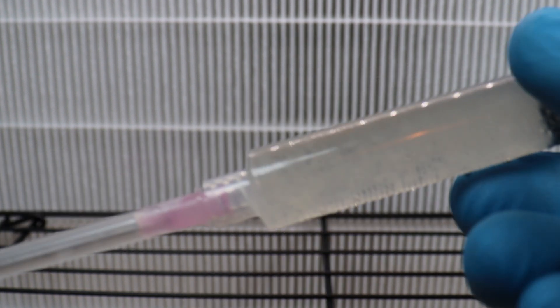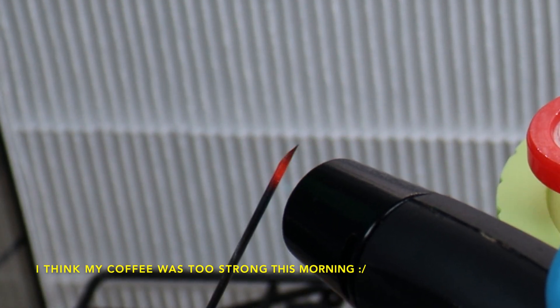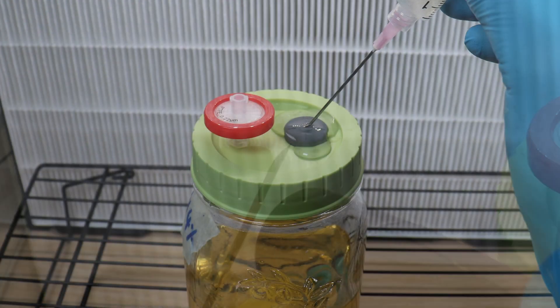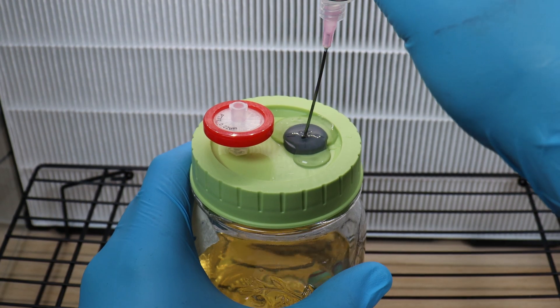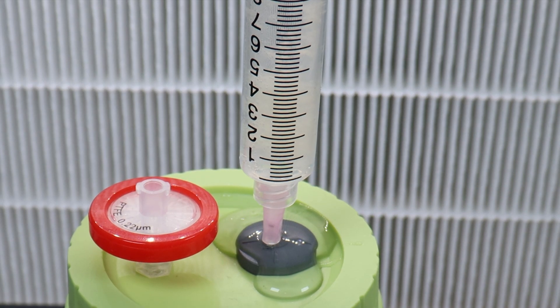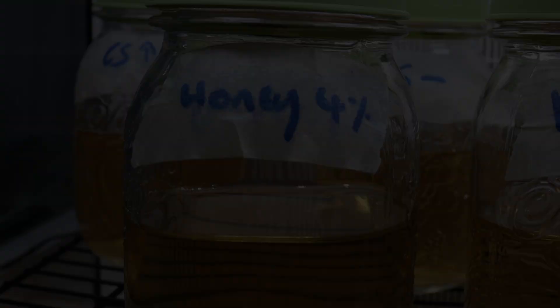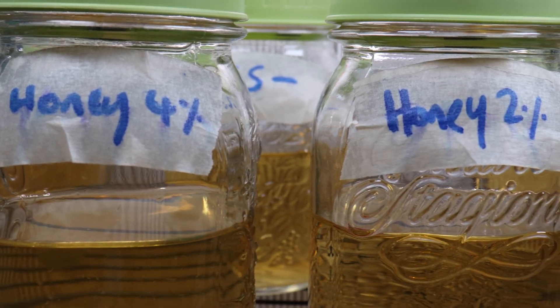It's time to inoculate our culture. I'm going to be injecting two cc's of this liquid culture I have into each jar, following sterile procedure all the way so we get a nice clean result. Six jars inoculated — there they all are. They have a nice amber colour to them.